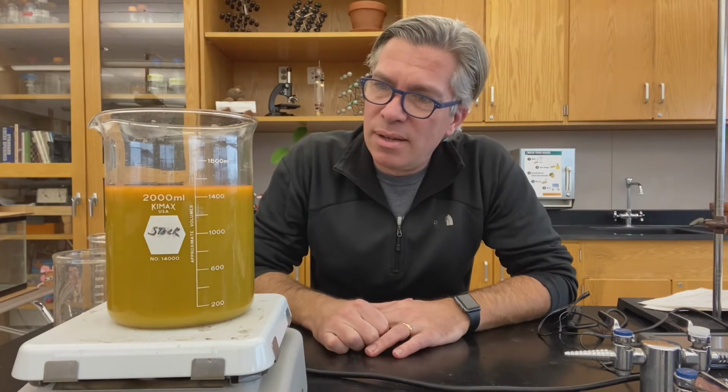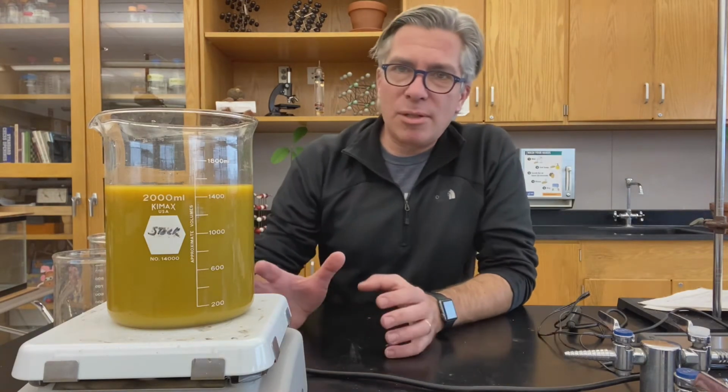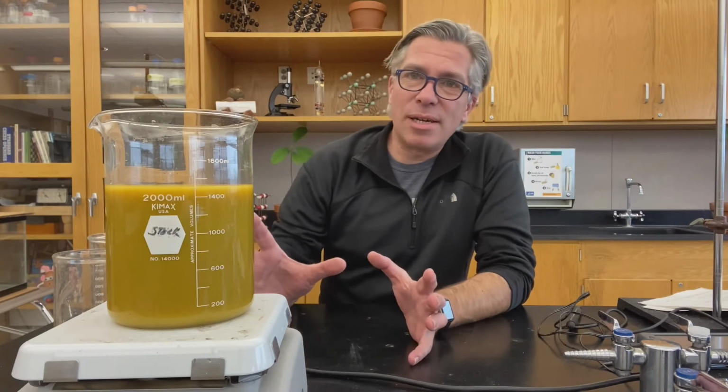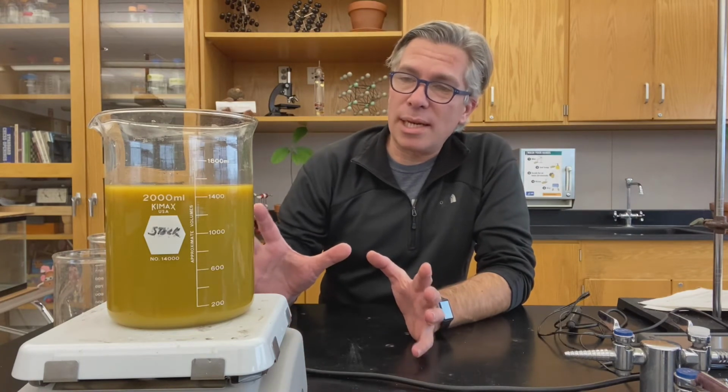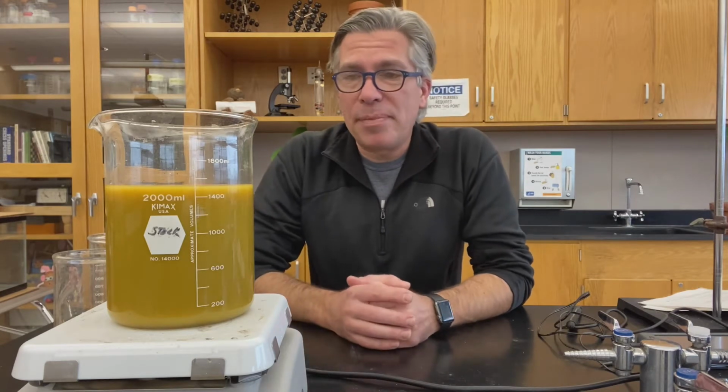Ooh, wow. That is an ugly green. Yeah. So this is about 20 seconds later. The ugly green is still there. I'm hoping that this reaction will work and then it'll move on into something better. So we'll give it a minute.